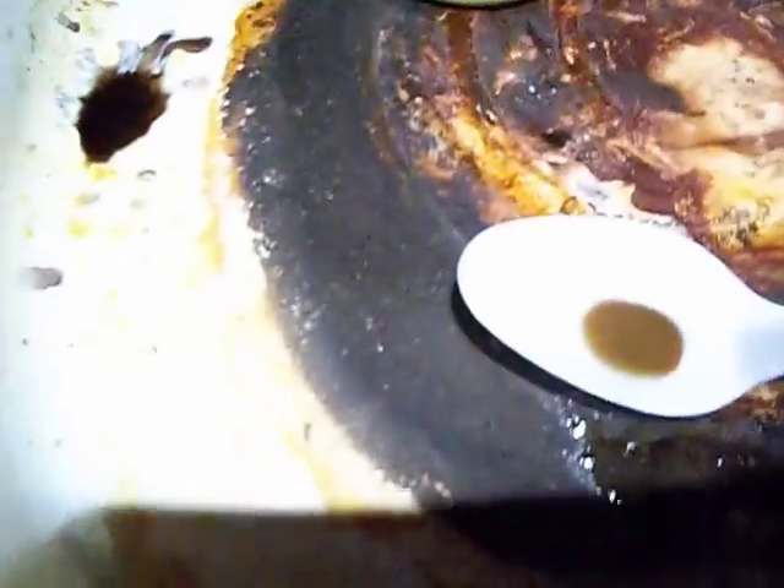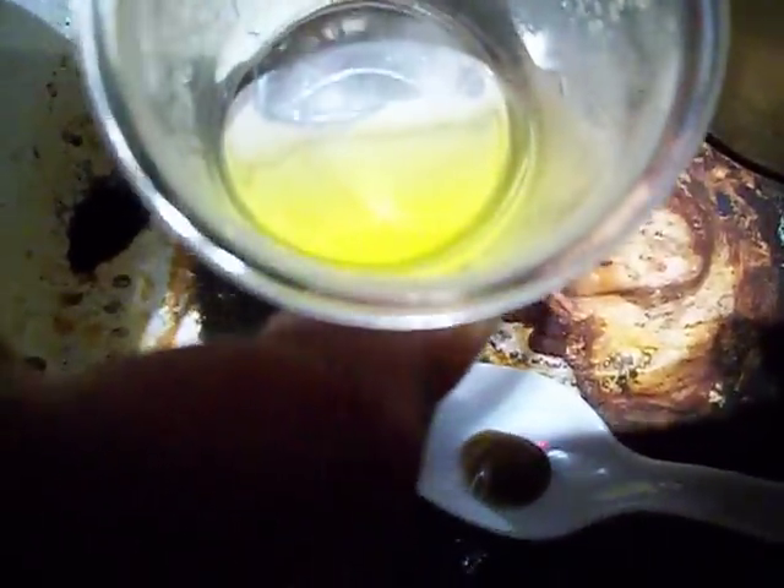That'd be real fun — get all this stuff scraped out of here and cleaned up. I'll get that little bit of gold solution out and put it in a bottle for my standard gold solution. I know there's some good gold in that. See, I didn't bring another spoon — see if I can get this one washed out.